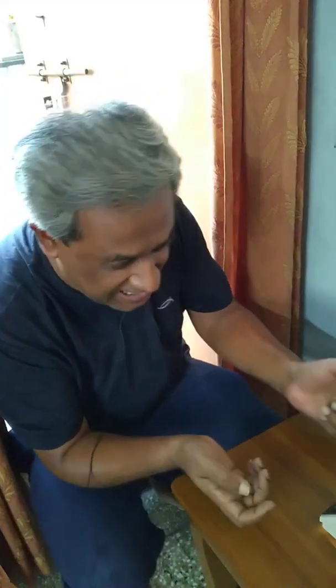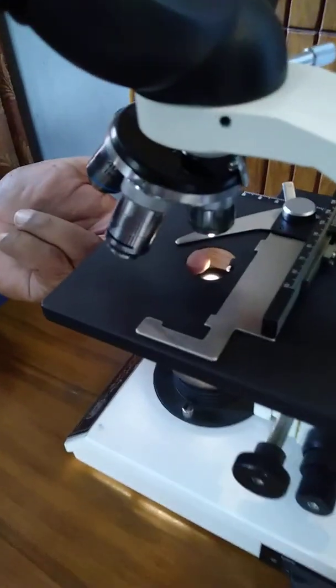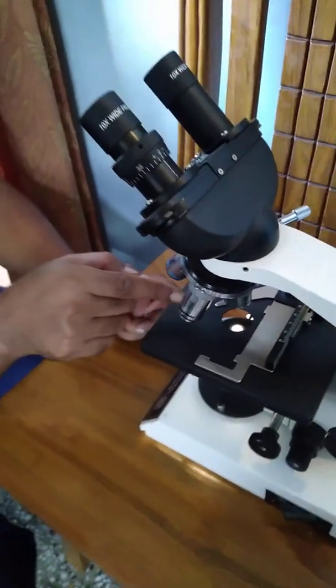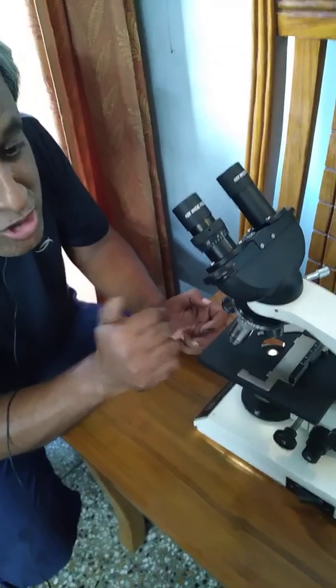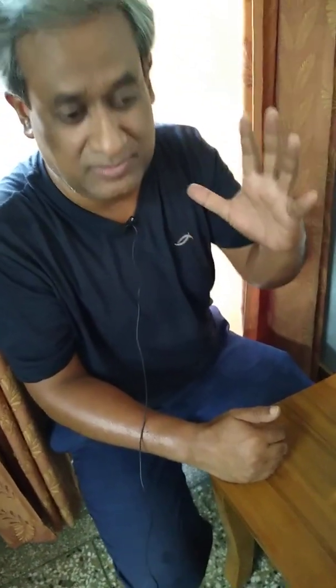So what happens is the light emerges from here and impinges upon the central portion of the stage, where my finger is jutting in, and there is a slide made of glass, 1.5, then the cedar wood oil 1.5, and the oil immersion objective touches it, dips into the oil. So all the media are 1.5, so there will be no diffraction or lateral refraction of the light, so there is no optical aberration. The organelles of the cell will be seen perfectly in a beautiful manner.